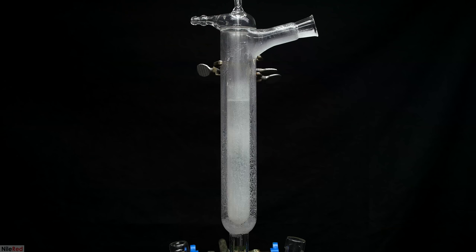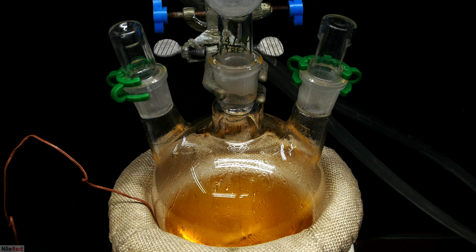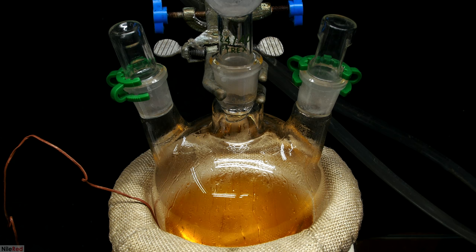I removed the water lines from the condenser, and we can see here that it's really dirty. This is mostly just paraformaldehyde, which has sublimated out of the flask. Anyway, the hot plate's removed, the solution's allowed to cool, and I set up another apparatus.